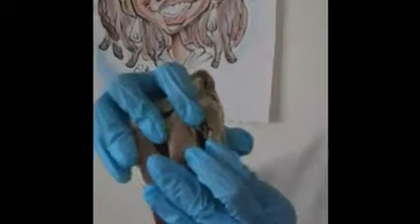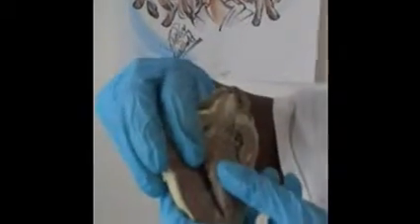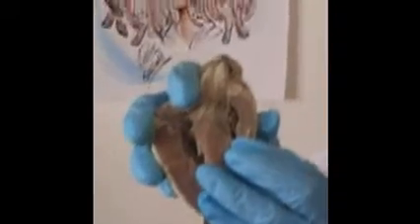Hopefully you can see that. It's down in there. Then we have the chordae tendineae, which is going to be right here on the right side. It's kind of hard to see, but it's going to be at the bottom of those cord-like structures there. And then we have the cusps of the valves, which, as you can see clearly on the left side, will be here. And then it has the same thing over here on the right side.